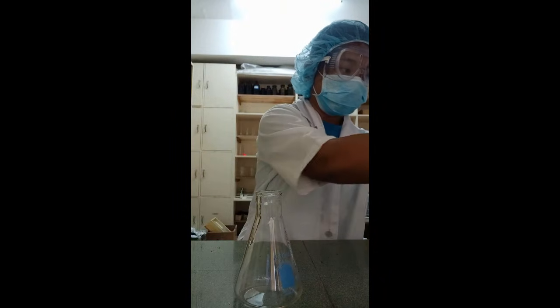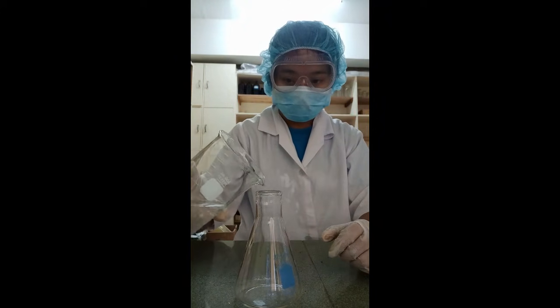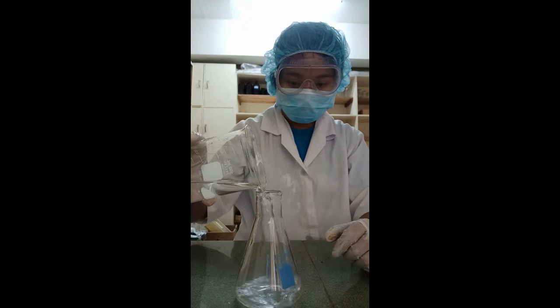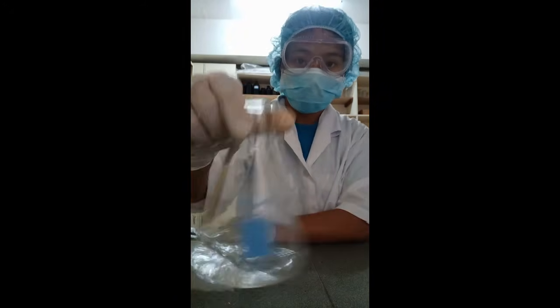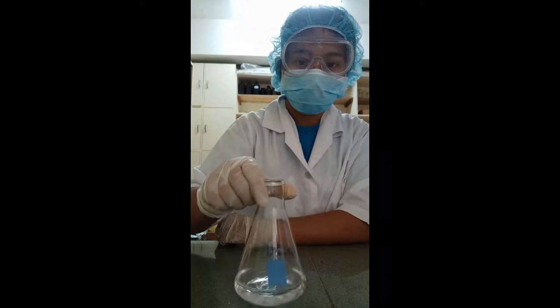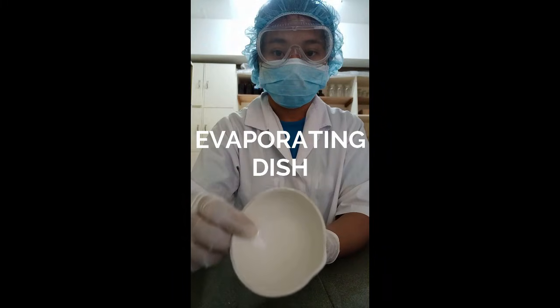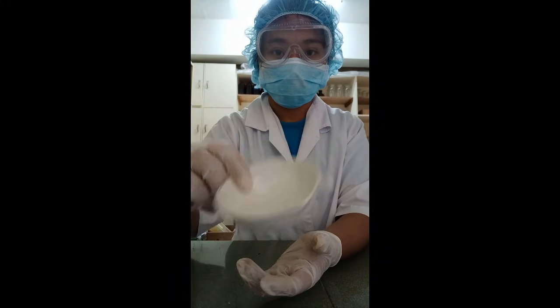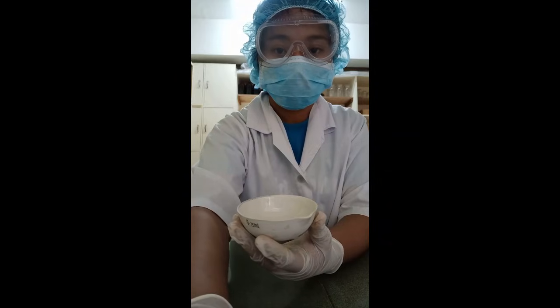It has a narrow neck and expands toward its base. It allows easy mixing and swirling of the flask without too much risk of spilling. Evaporating dish. It is used for the evaporation of solutions and supernatant liquids and sometimes to their melting point.